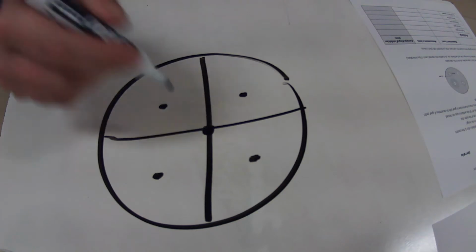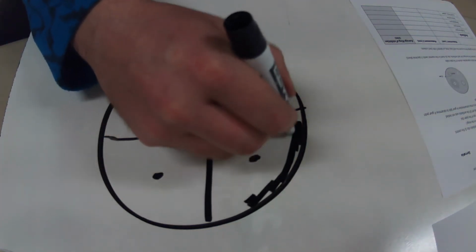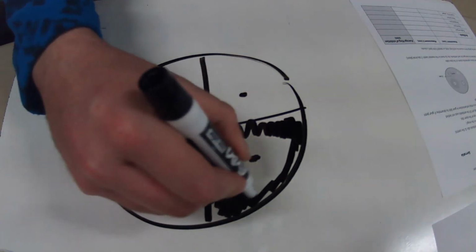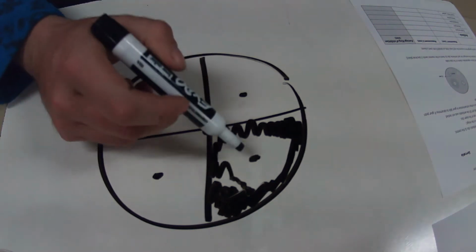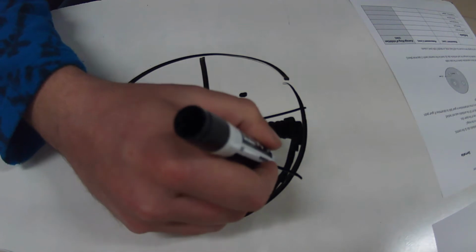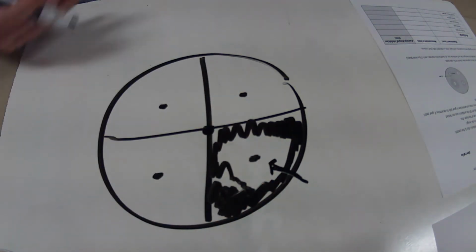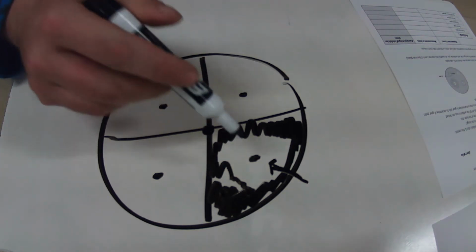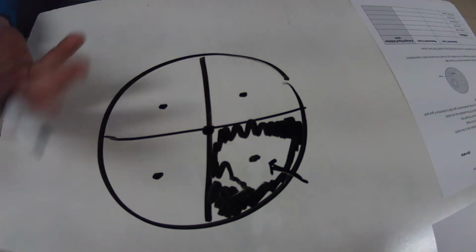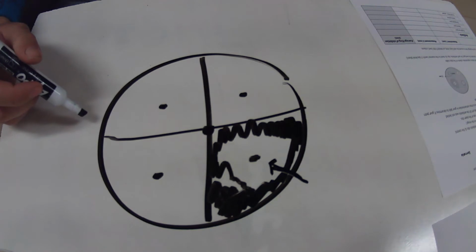But as you're going to notice, I'm just going to focus on this one quadrant right here. The bacteria might have only grown here. Now, why didn't it grow in this clear spot? This clear spot right there is going to be called the zone of inhibition. What this means is that the antibiotic actually killed the bacteria. That bacteria is not resistant to the antibiotic, so hence why it died, giving this a zone of inhibition.